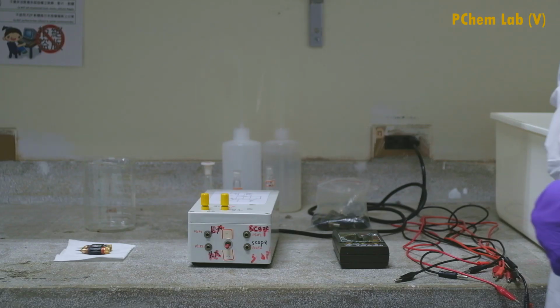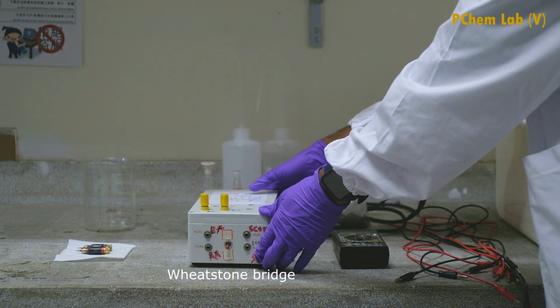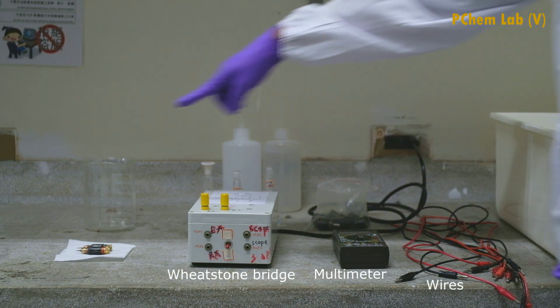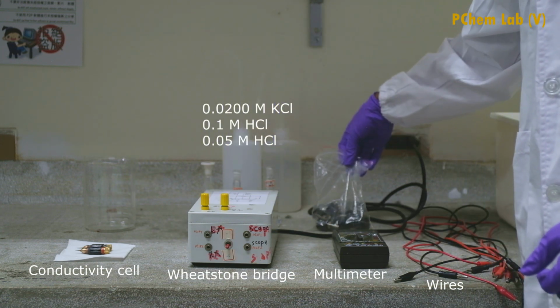We are going to do experiment number 1, the conductance of solution and determination of dissociation constant. In this experiment, you are going to find out the dissociation constant of acetic acid, measuring the conductivity of some solutions. In this experiment, you may need different equipments. Here you can see the Wheatstone bridge, multimeter, connecting wires, conductivity cell, different solutions, and the variable resistors.